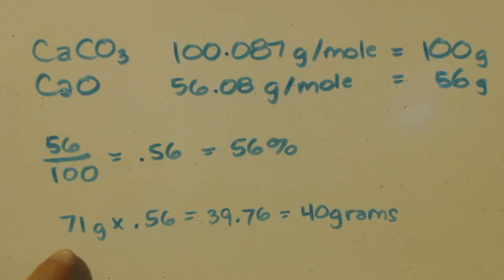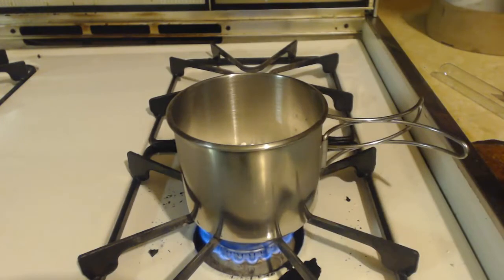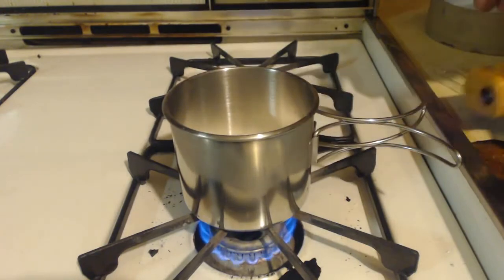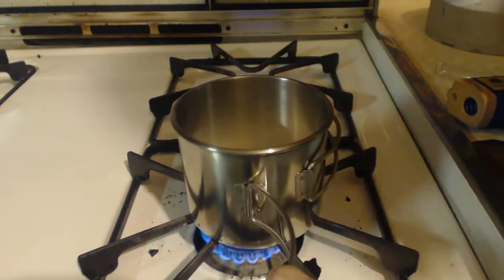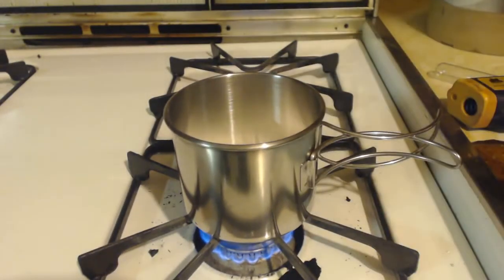So I just weighed mine up. I have 71 grams. So I took that times 0.56. I got 39.76, which obviously I rounded up to 40 grams. So now I'm just going to heat this up. This can I got at Walmart, in the fishing and hunting section. It's got little handles. You can move these handles so it goes around the cup. So you just put them in storage, and then you take them up to the handle.